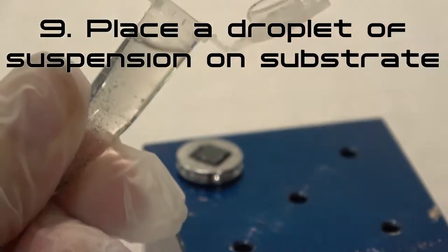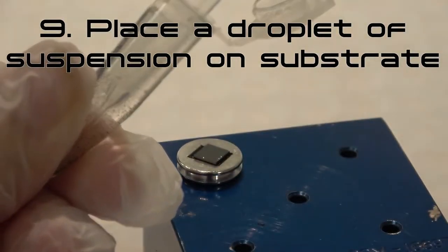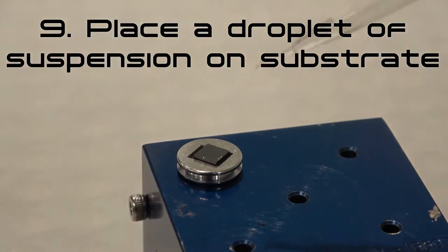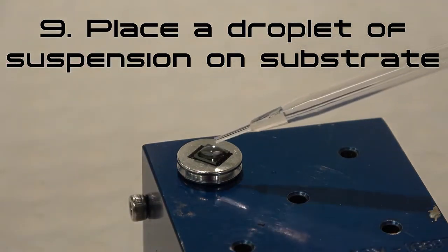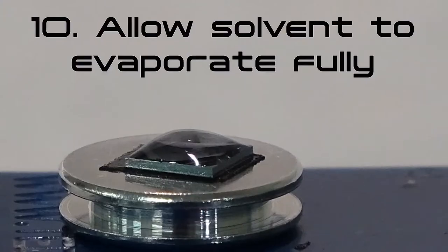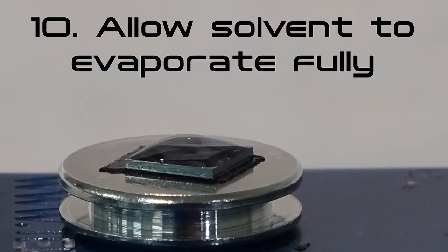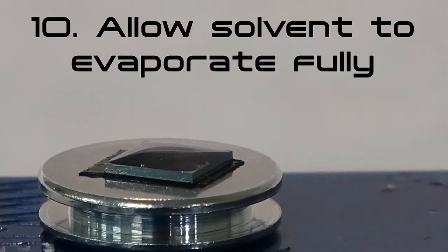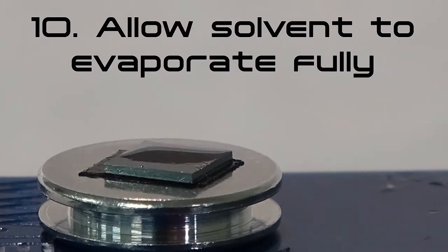Step 9: Using a disposable fine tip pipette or a micropipette, take up a small quantity of the ultrasonicated sample and place a droplet onto the substrate. Step 10: Allow the solvent to evaporate fully. Ensure that the sample is completely dry before attempting SEM examination.